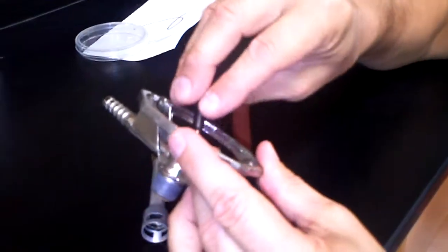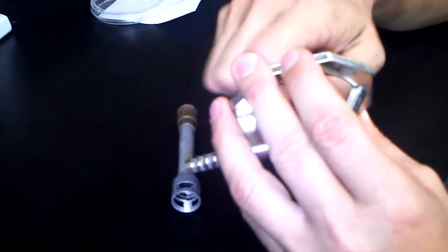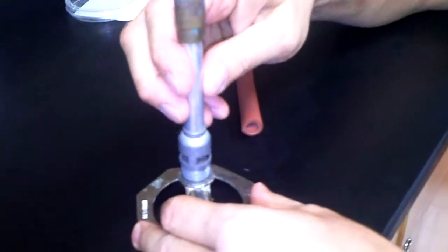Put the valve back in to the base. Screw on the barrel.